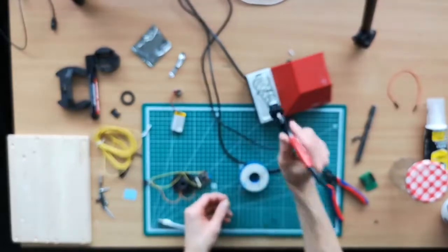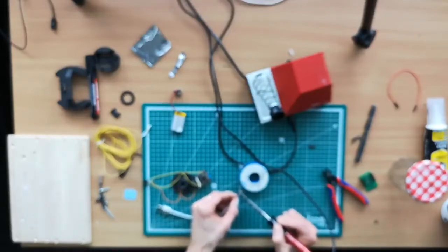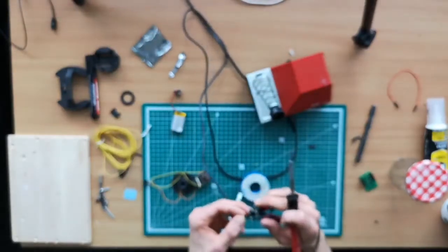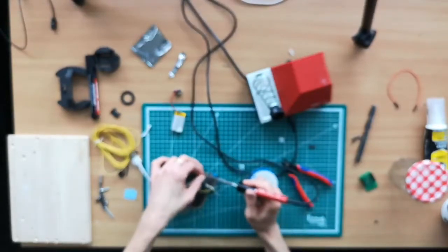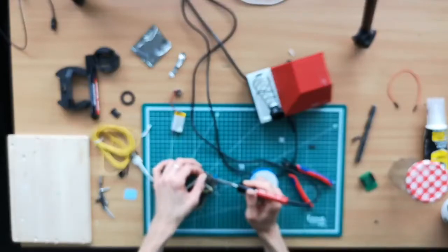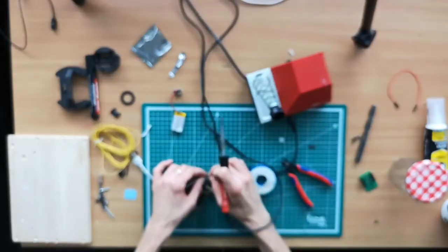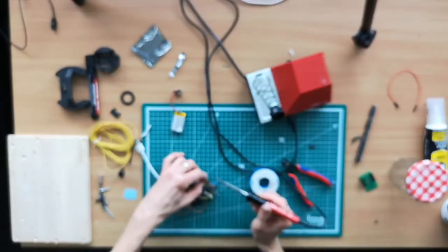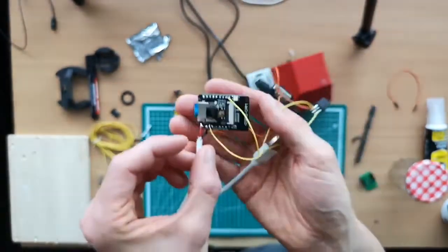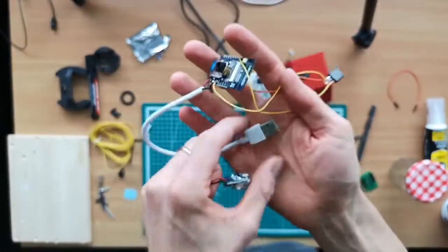And the strategy is adding lead and then wiring that up to the ESP32, knowing that we already occupy the 5 volts, so we have to piggyback it. Make them a little shorter so that they don't cause any shortcut. And then use the 5 volts and ground nearby. And this is everything you need. So 5 volts, ground, and then 5 volts for this bit here. So that's it.